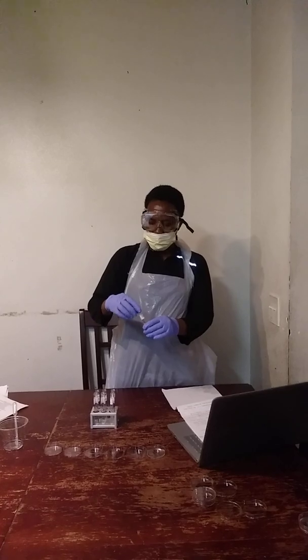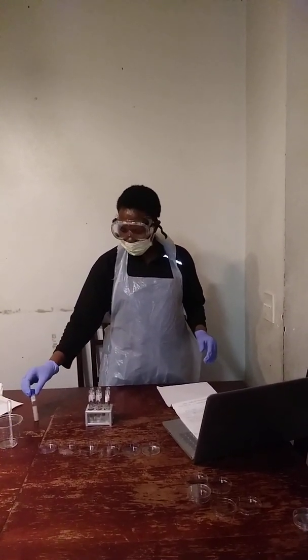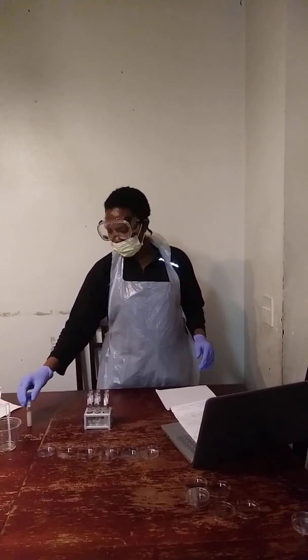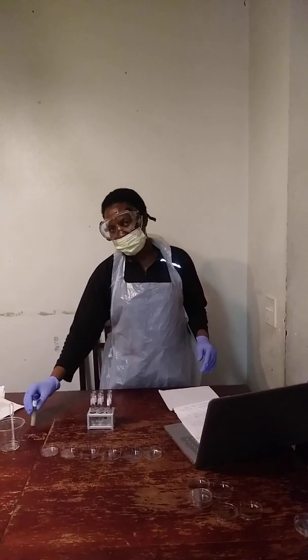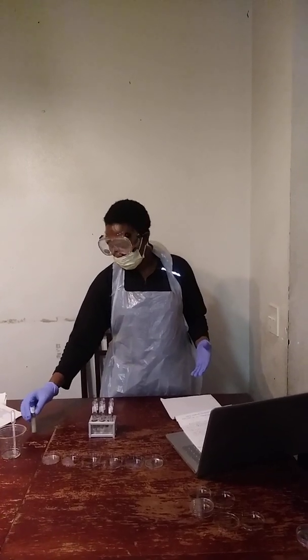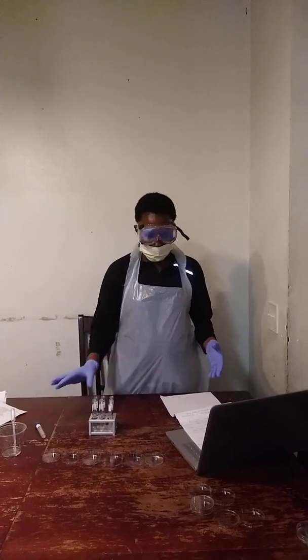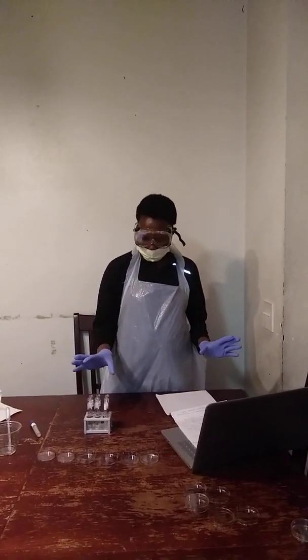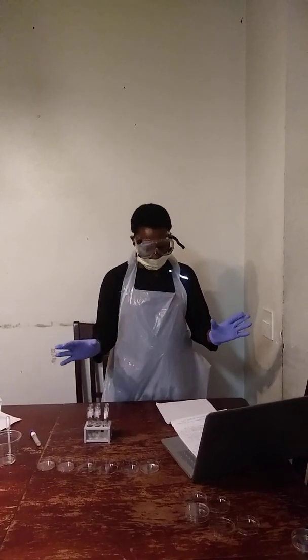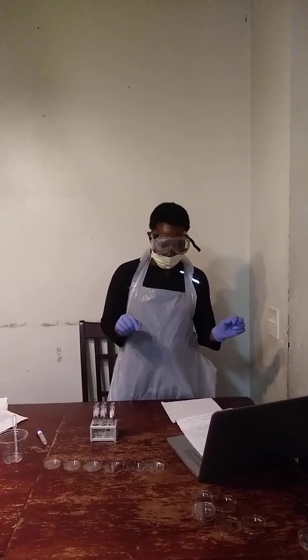And so the microbes that are under 30 are too few to be counted. The ones that are above 300 are too many to be counted. And so basically I will choose the one which is in between 30 and 300. So to calculate, I will say volume added divided by final volume.